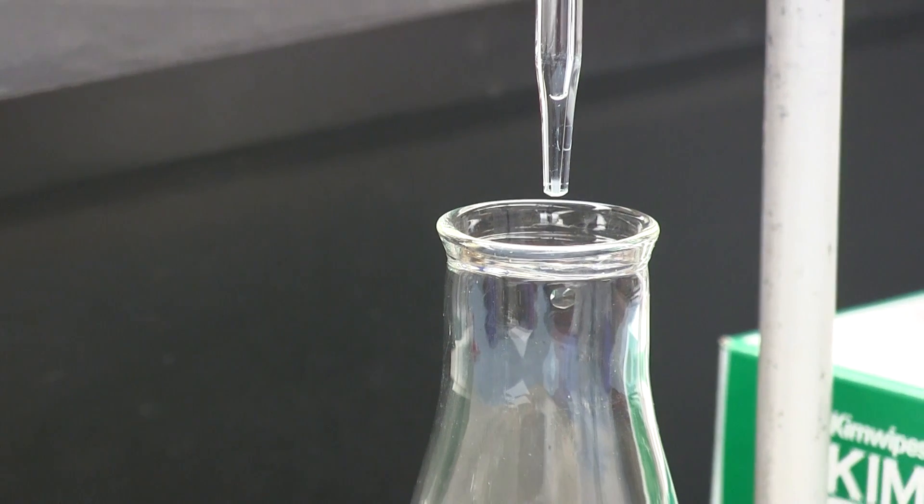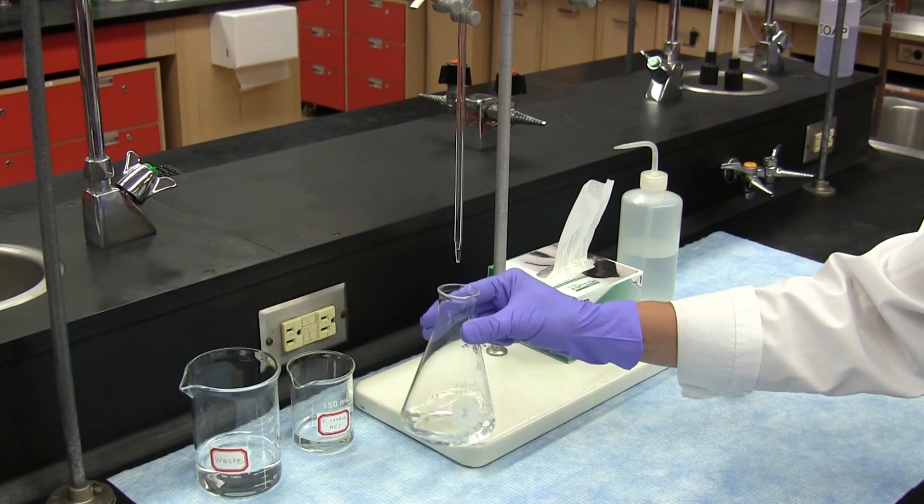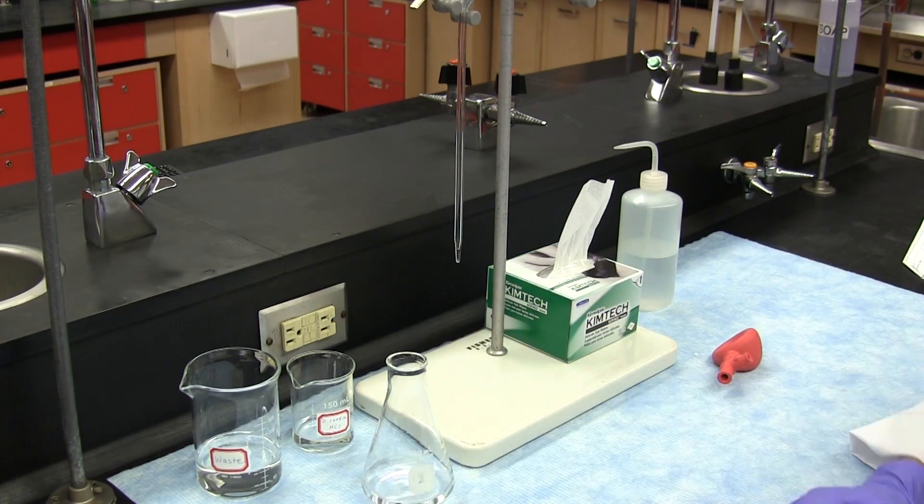Remember that the pipette has been calibrated by the manufacturer to deliver the precise amount 25.00 milliliters in this case and it's been calibrated to not include the small amount of liquid left in the tip only when it has been used in exactly the way described.